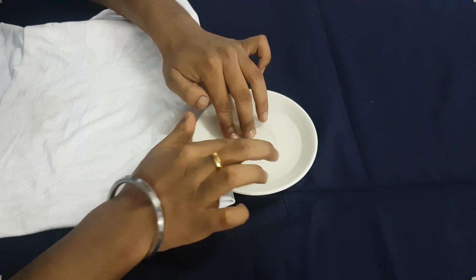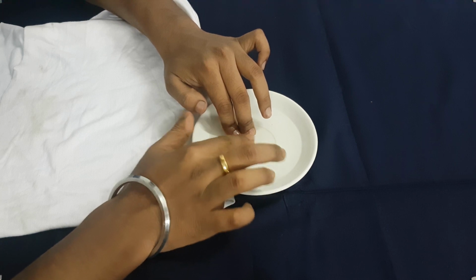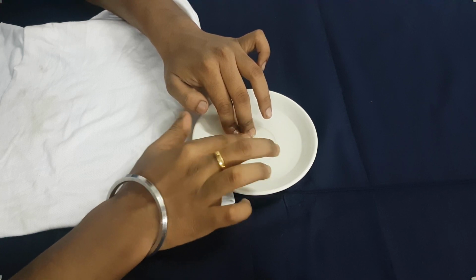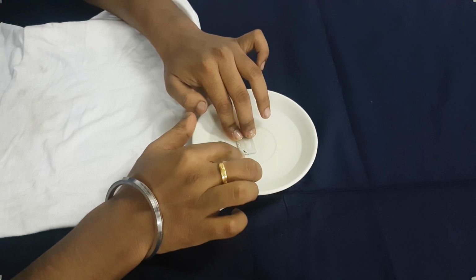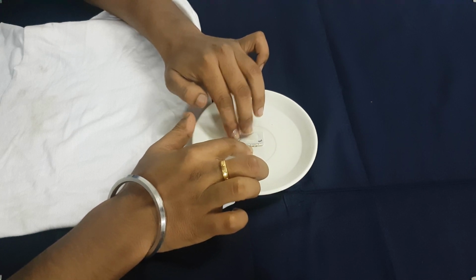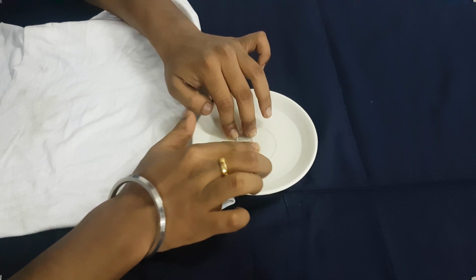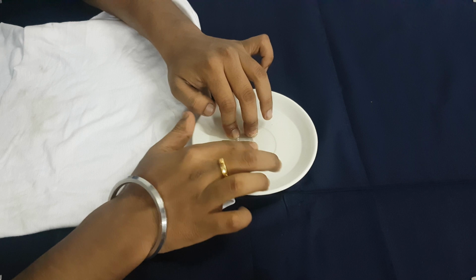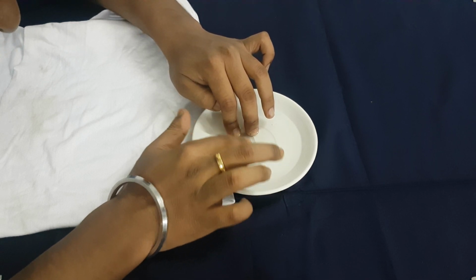Okay, let's rotate it, and I don't have any magic tricks to show you so that the number 3 becomes number 1 suddenly in the next frame, but yeah, that's why I have marked 3 over here also, and there are 3 dashes over here also, so that it's clearly visible to all of you that there is no magic trick going on over here, such that I'll make it vanish on my own.